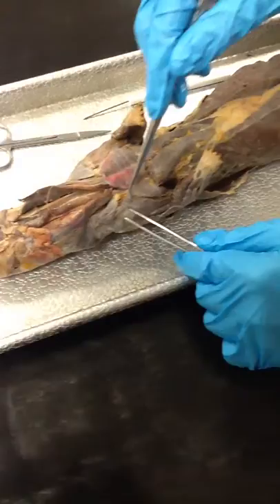Inside we have the cleidomastoid right here. This is clavotrapezius, clavodeltoid, pectoralis major, and then pectoralis minor.